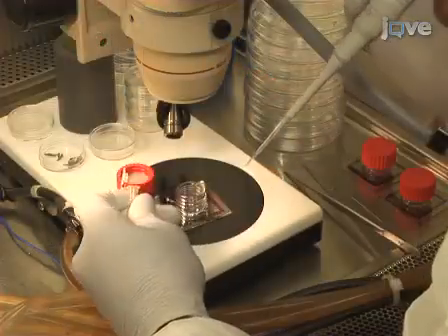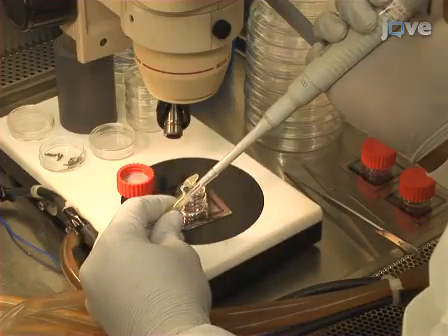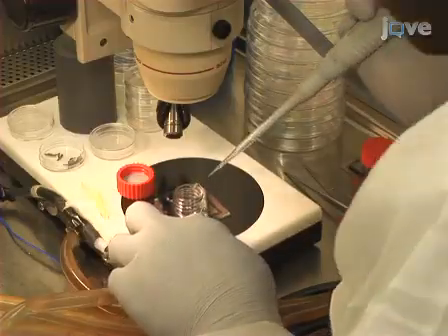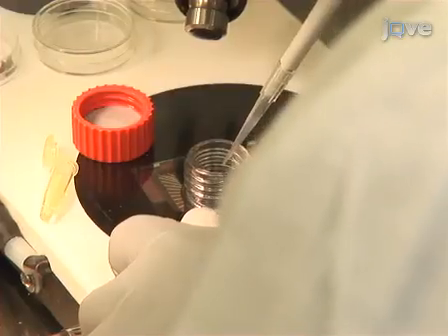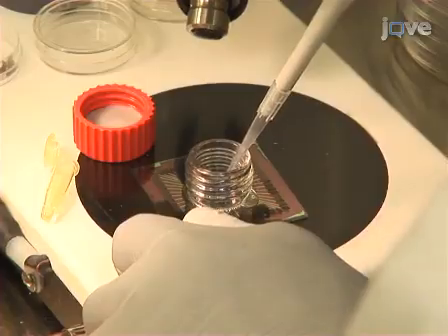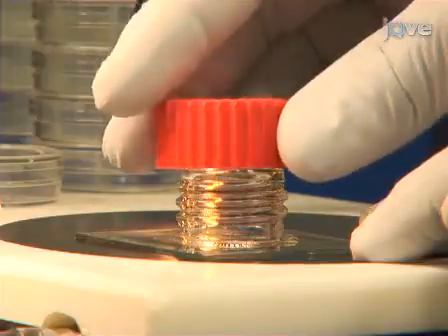Now, coat the MEA surface inside the culture chamber with poly-D-lysine. New MEAs, as used in this experiment, are rather lipophilic. Hence, coat by repeated droplet aspiration of the solution from the electrode grid. Attach the cap to seal the MEA chamber for storage and future use.